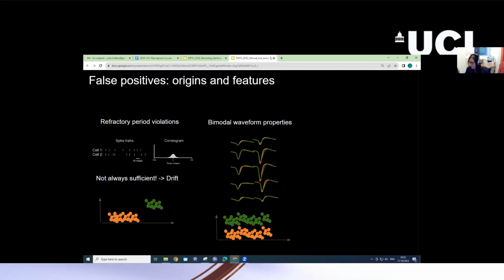In particular, you can see if there are bimodal or multimodal waveform properties. So again, here representing some feature of waveforms, which could be waveform amplitude as a function of time, you can see what appears to be two different spikes that are from two different neurons. And these spikes can have, as we said, different waveform shapes. There can be two different clusters that you might want to separate in your data.